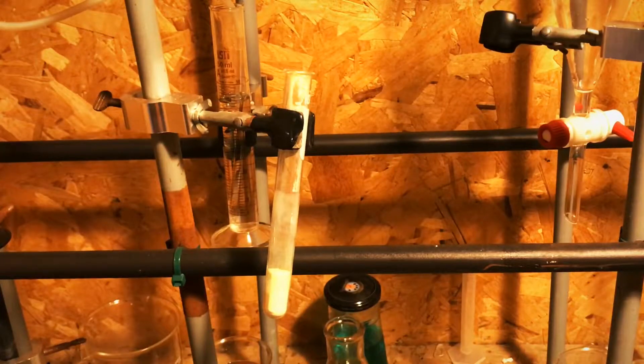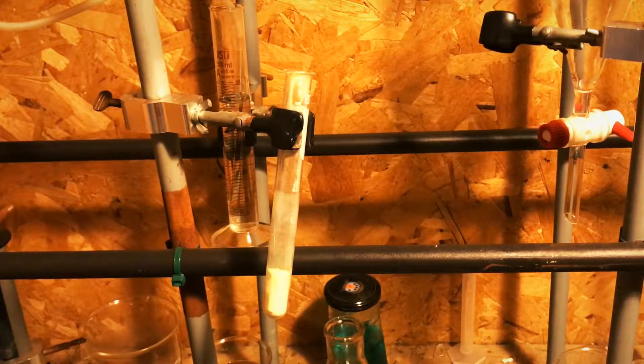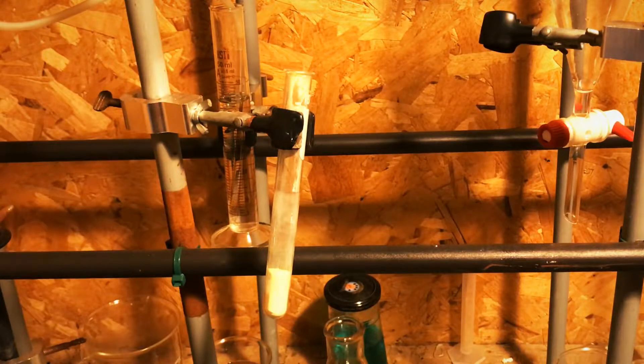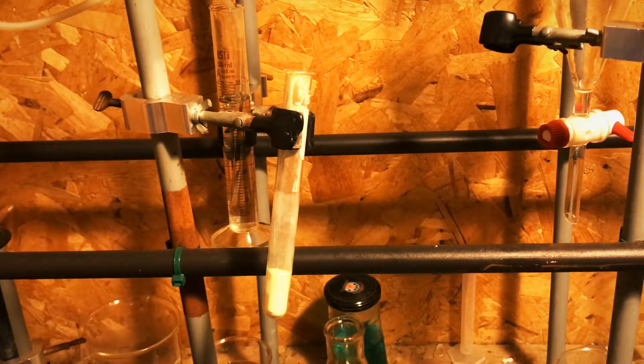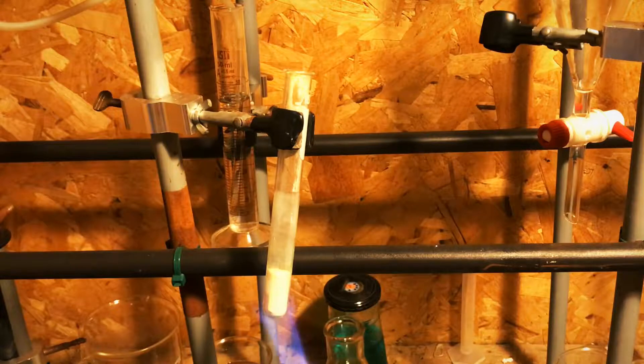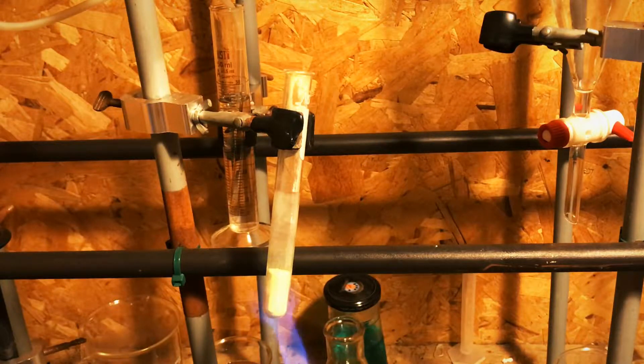Now let's head to the laboratory and let me demonstrate how to create amorphous sulfur. To create amorphous sulfur, I'm first going to heat the sulfur up here in this test tube.